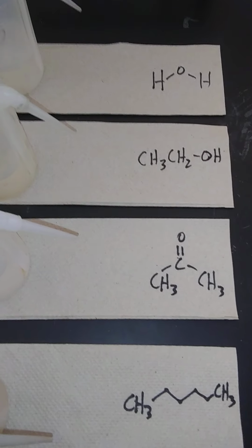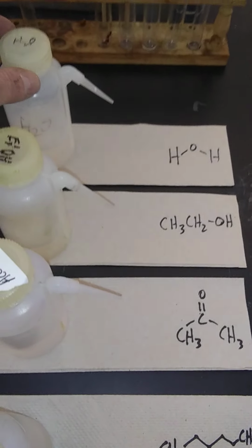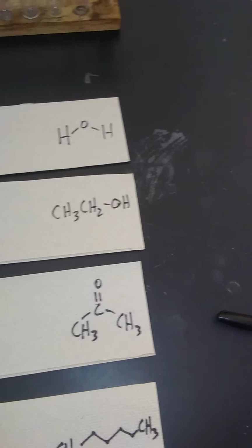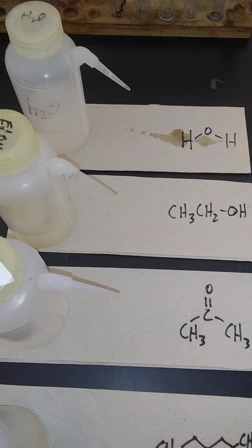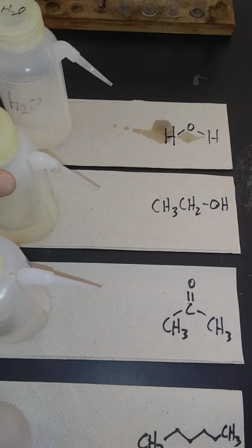What I want to illustrate is that if we take the water, and I've put the caps on tight for all 4 of these, if I shake the water up and let it sit, nothing comes out. And I'll squeeze it just a little bit just to get it started, and nothing more happens. It's just squirted a little bit of water, so typically we'll keep the caps tight. Now I'll do the same thing with the other 3.